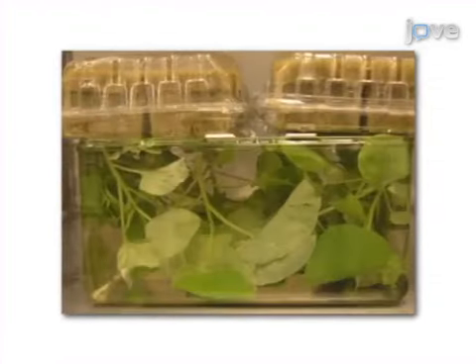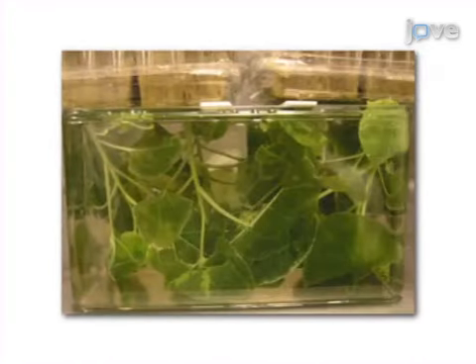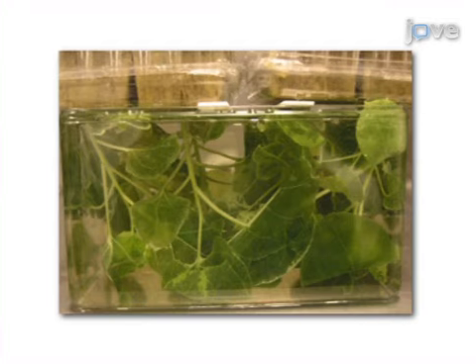During Agrobacterium infiltration, the plants are flipped upside down, and aerial parts are submerged in an Agrobacterium suspension. A vacuum is then applied, causing air to be evacuated from intercellular spaces in leaf tissues through stomata. Rapid repressurization following release of the vacuum results in the infusion of the Agrobacterium suspension into leaves.